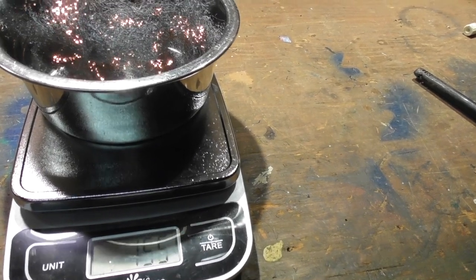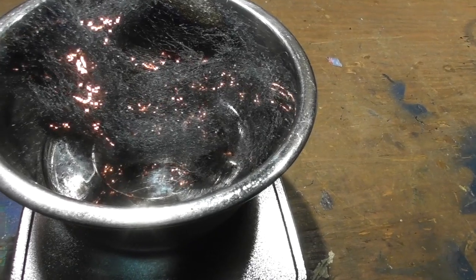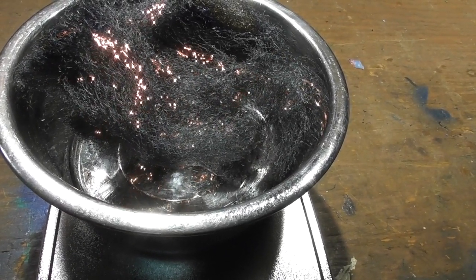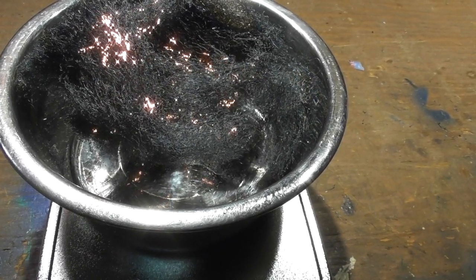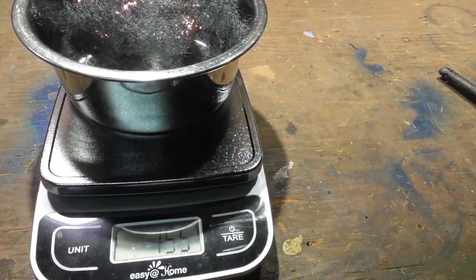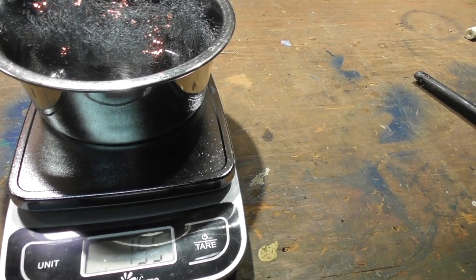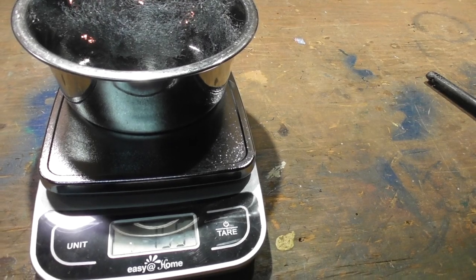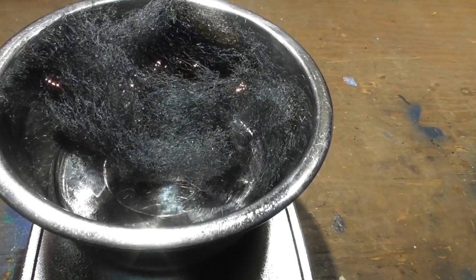Now, if you'll notice, the mass is now at 155 — still burning. The question is: why is it that when you burn steel wool, you would think the mass would go down, but in fact the mass has gone up to 155? And if it continues to burn, it may even go up to 156 — and there it is, 156 grams. So let's talk about that.